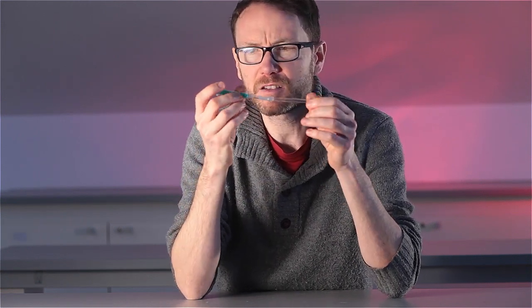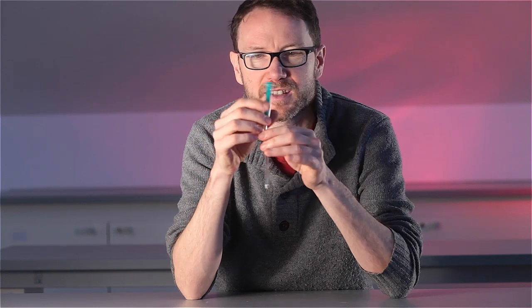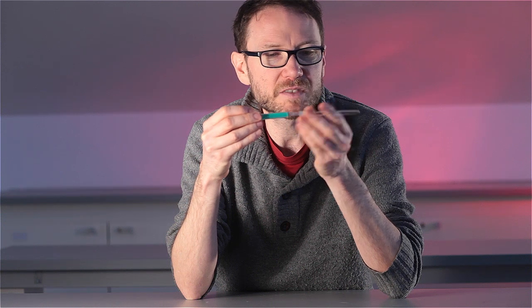When it comes to drawing up the liquid, I found it tricky to speak to an audience while also controlling the pressure on the teat pipette and also focusing on where I'm delivering it into the solution. So I've made myself this little apparatus here. All it is is a small syringe attached to a Pasteur pipette down on this end.